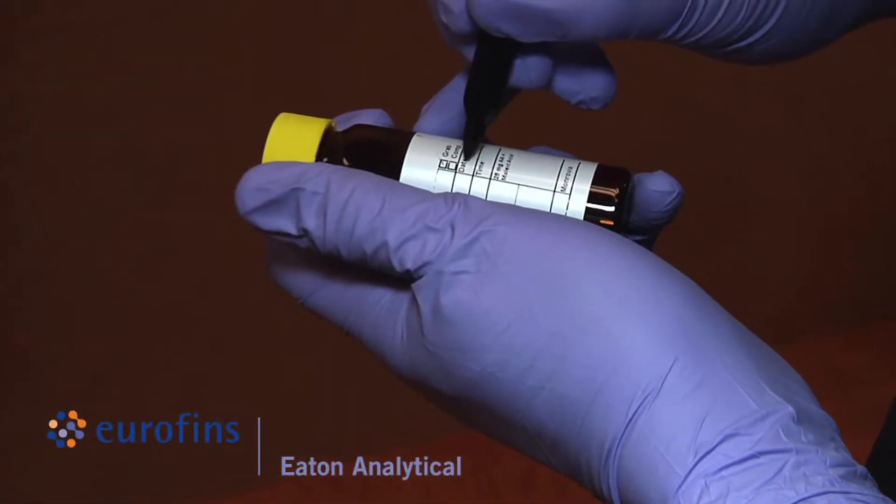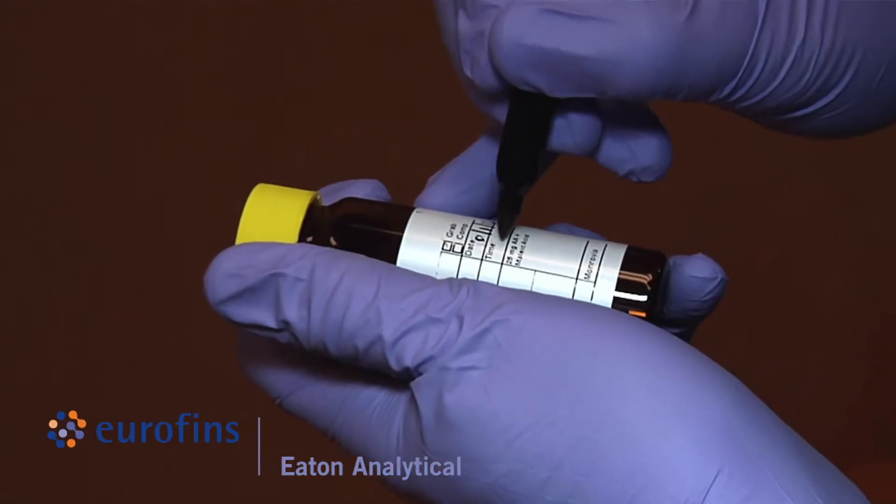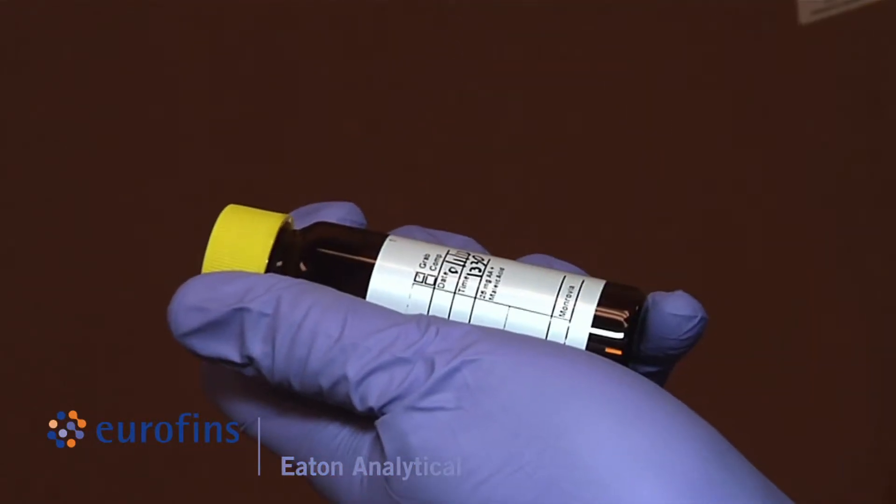Before filling, label bottles with required information that is not already pre-printed such as the sample ID, date and time of collection.